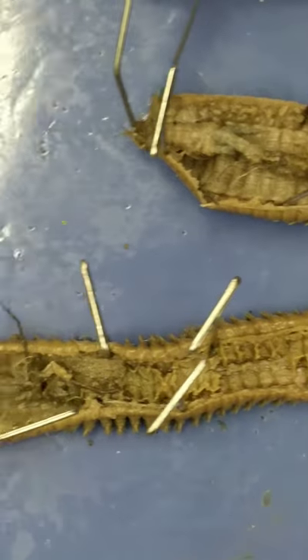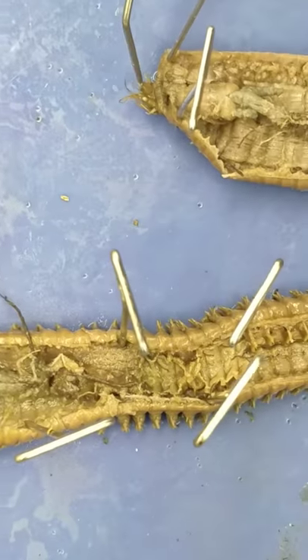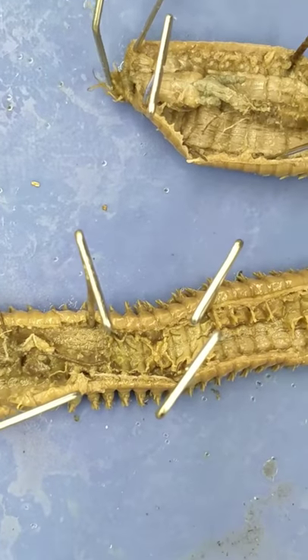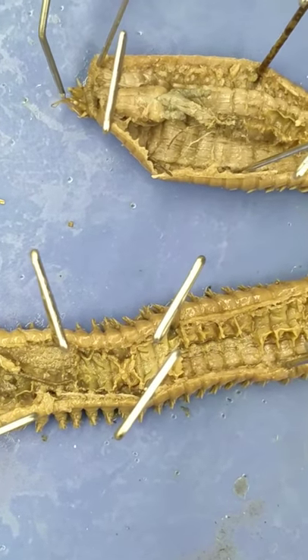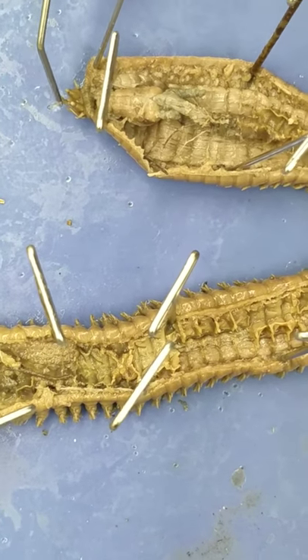And then over here we have the palps, and then we have the peristomial tentacles.